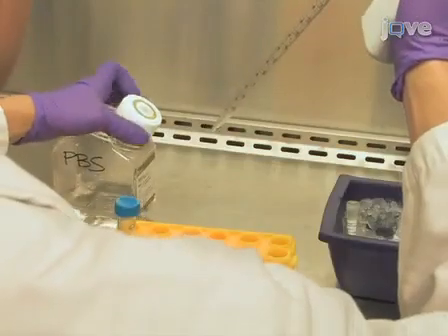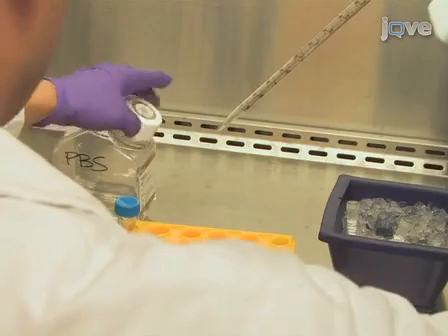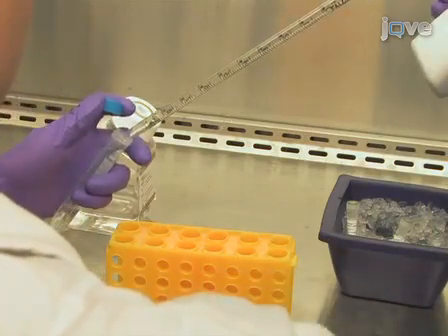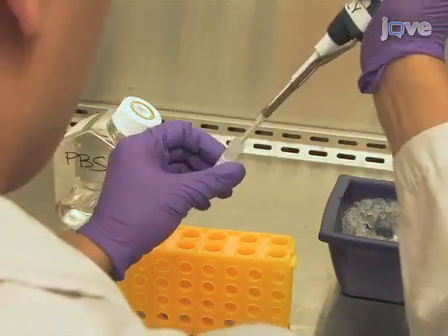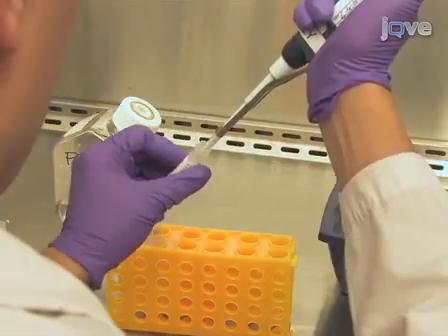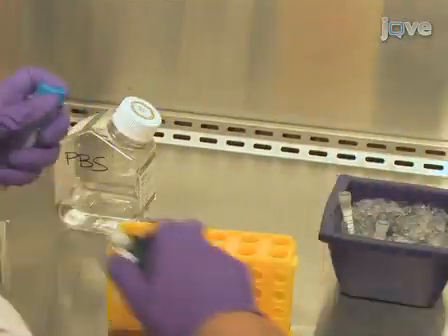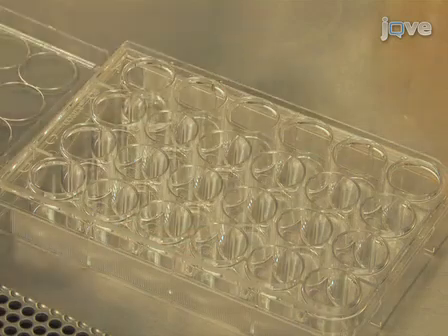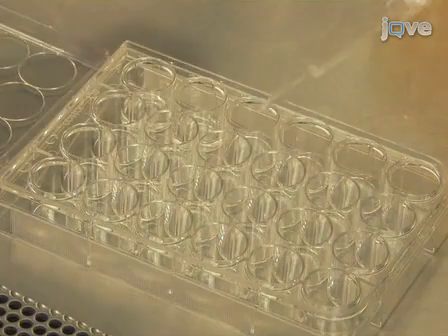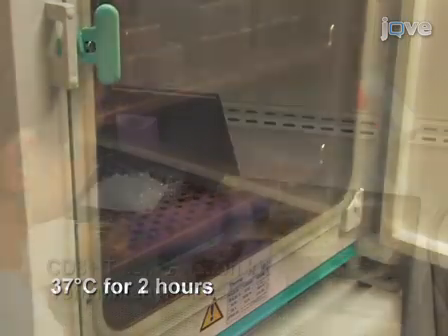In order to activate the mouse T-cells before viral transduction, coat plates with activating antibodies, namely anti-CD3 epsilon and anti-CD28. Prepare an antibody mixture of 1 microgram per milliliter of anti-CD3 epsilon and 2 micrograms per milliliter of anti-CD28 in sterile PBS. Dispense 250 microliters of the antibody mixture into each well of a 24-well tissue culture plate and incubate for 2 hours at 37 degrees Celsius.